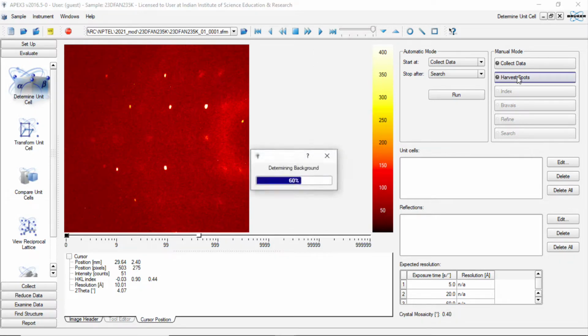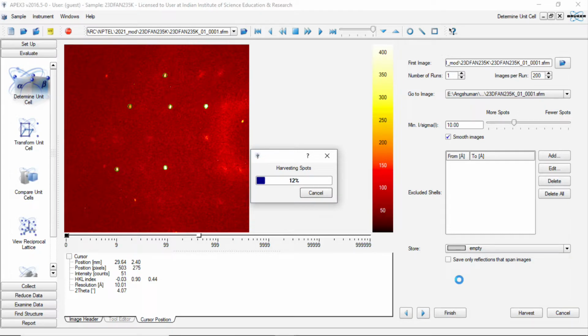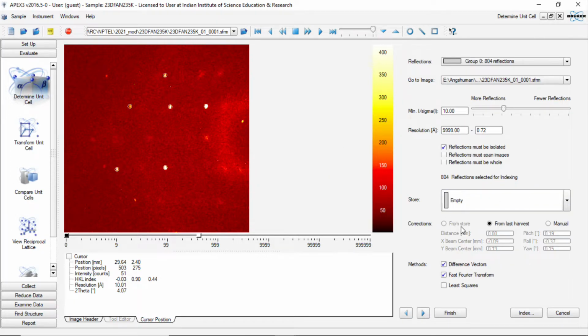So if we try to read these reflections, we will read one set of reflections from a total of about 200 images with I by sigma equal to about 10, so that we take care of large and small reflections, that is, strong and weak reflections. It will take a while to read these reflections from the 200 frames that were collected during the data collection procedure. Once it completes harvesting, it will allow us to do the indexing. So now it is letting us do the indexing.